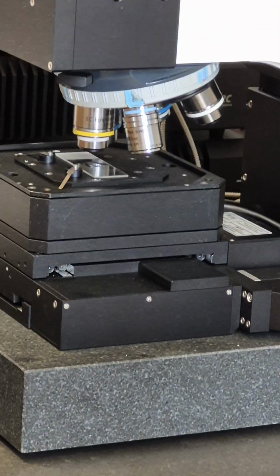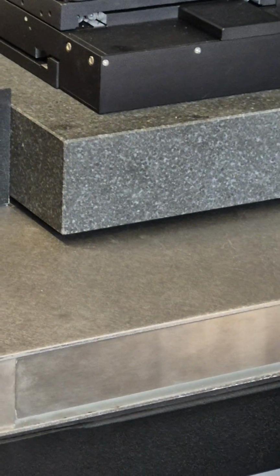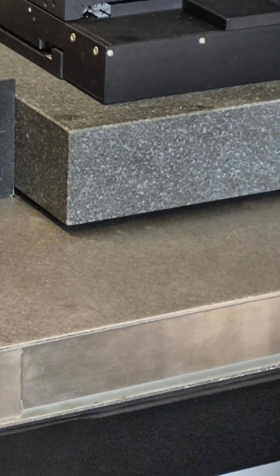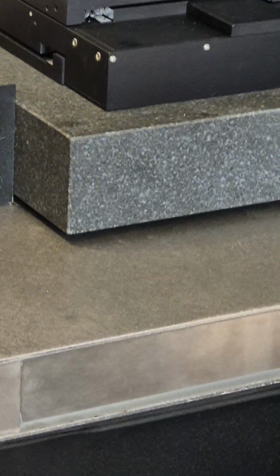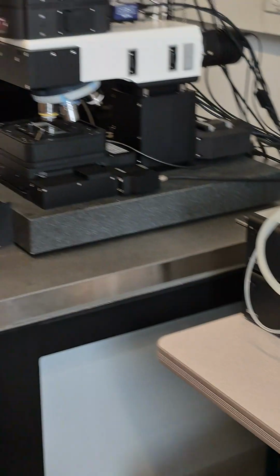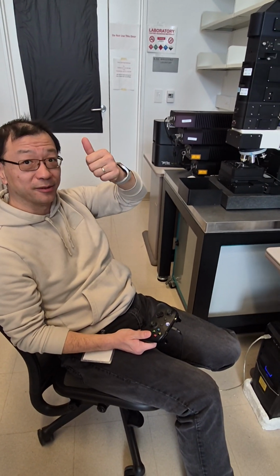Maybe less than that. It's more than that. You must lower your head, perpendicular to that distance, and just estimate. It's definitely more than 1 centimeter. Okay, so I should move down. Yeah. Okay, so if you cannot see whether you should move up or move down, you should always move up. Okay. It's safe, right? Yeah.